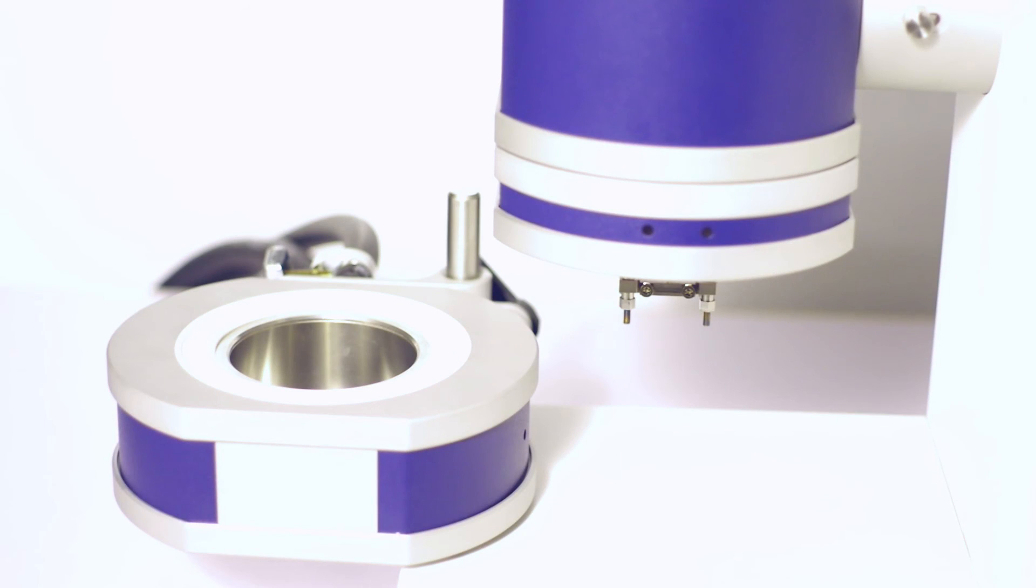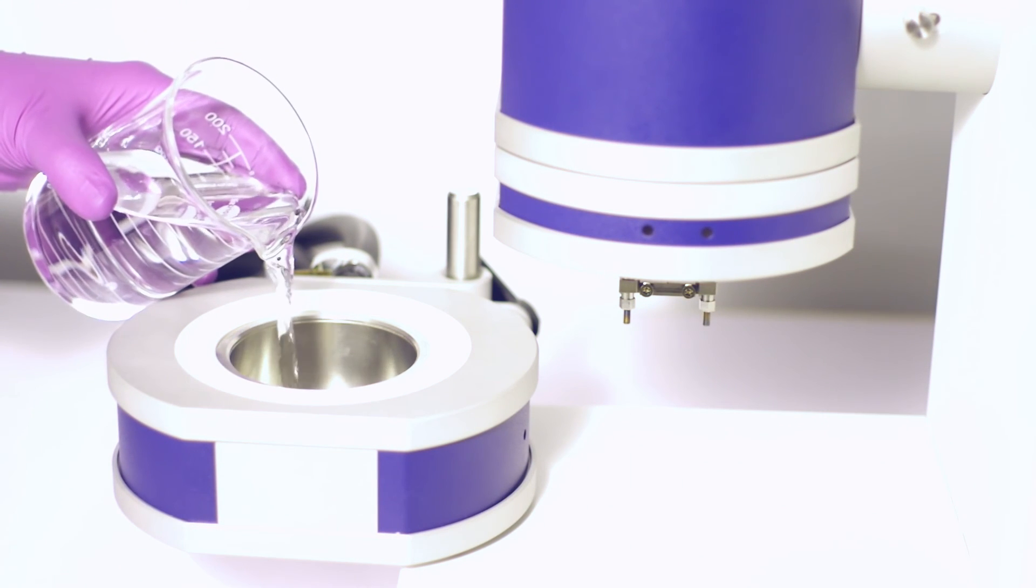The measuring head should be in the vertical position. Now, fill the bath with liquid. In this case, water.